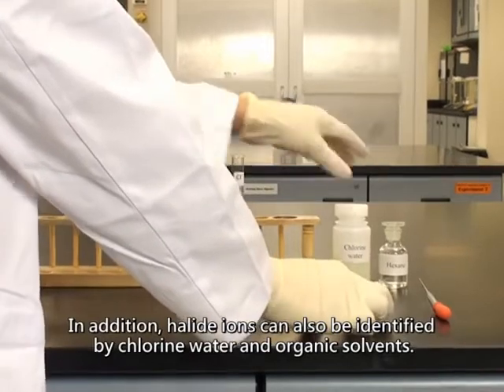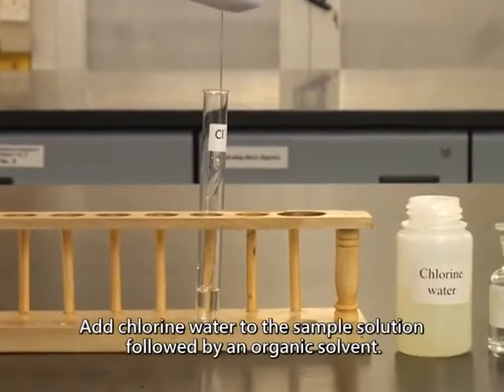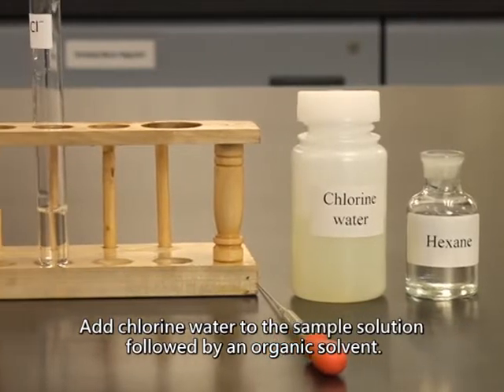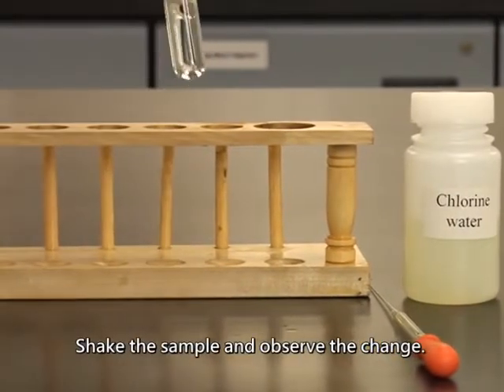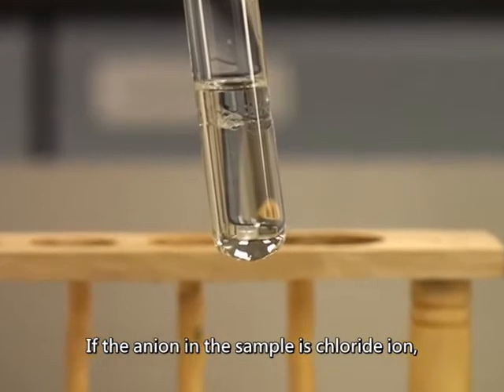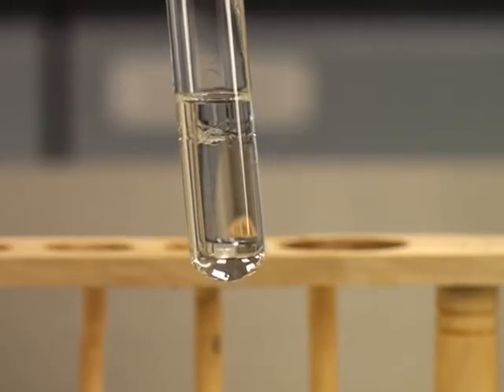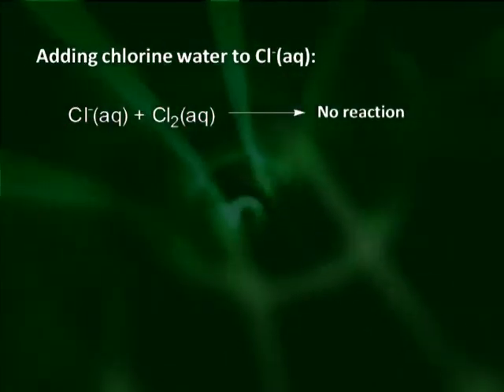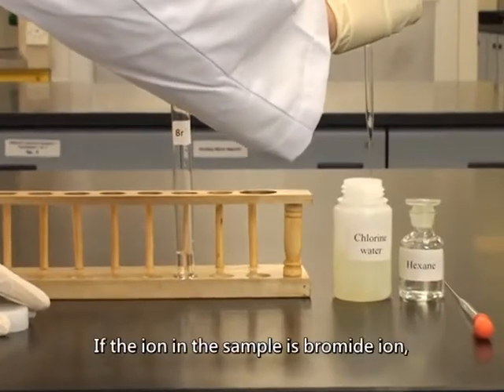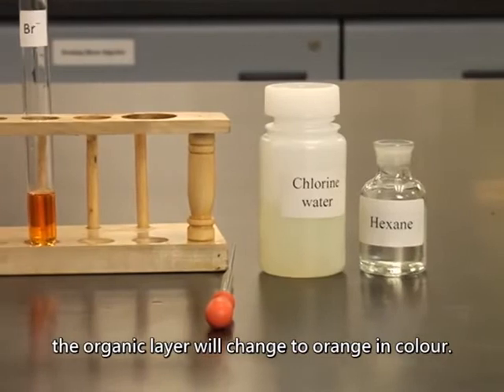In addition, halide ions can also be identified by chlorine water and organic solvents. Add chlorine water to the sample solution, followed by an organic solvent. Shake the sample and observe the change. If the anion in the sample is chloride ion, there will be no observable change. If the ion in the sample is bromide ion, the organic layer will change to orange in color.